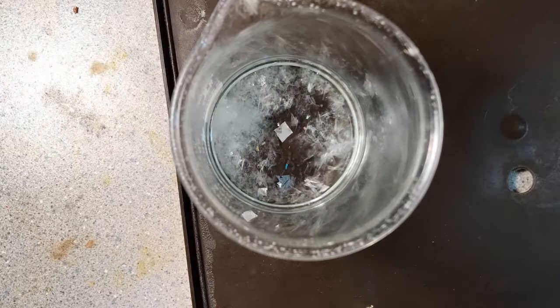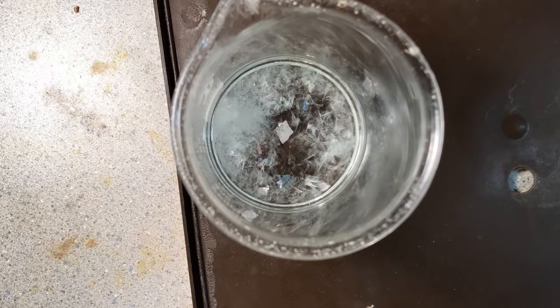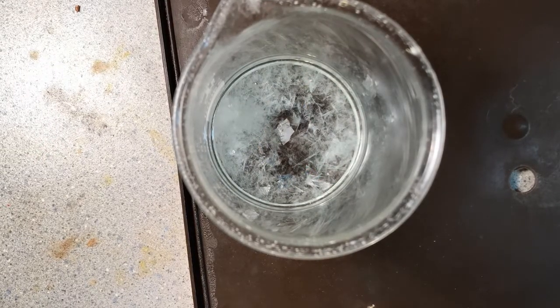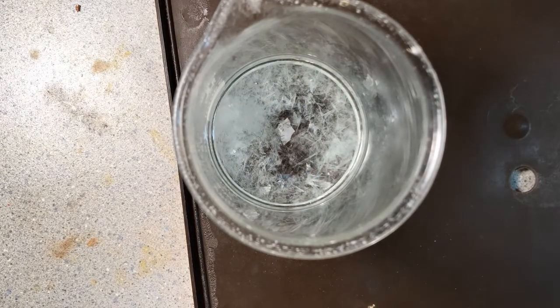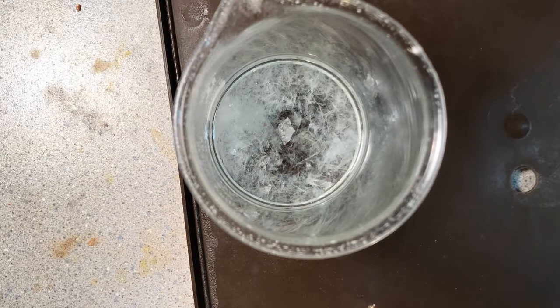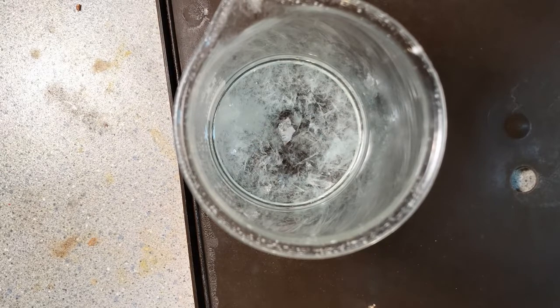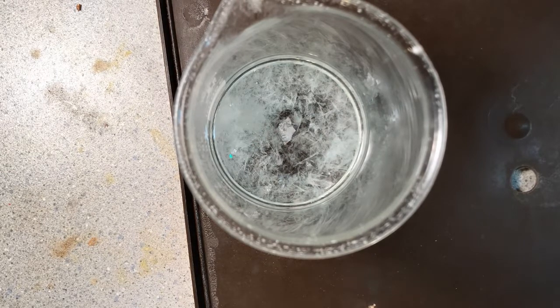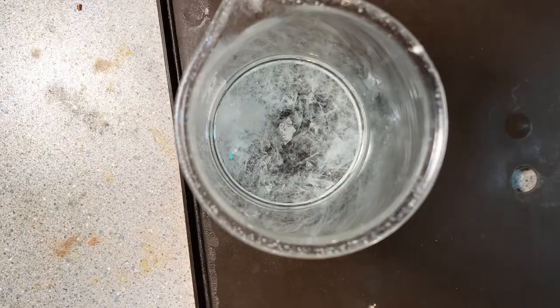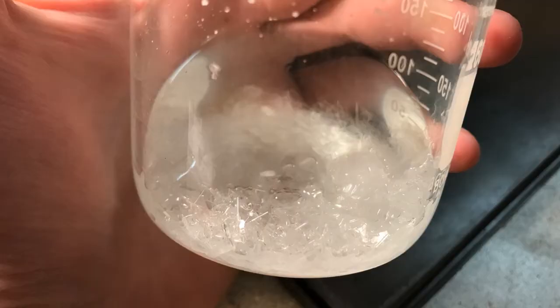So in the recrystallization, I add some water, heat the crude mix up, and we get really nice crystals coming out of solution. And I got a good time lapse of that. And there are the crystals.